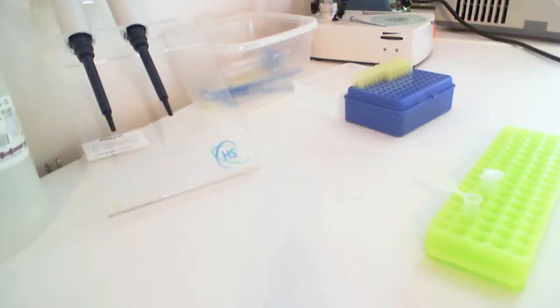Hello and welcome to cloning a fluorescent gene. Before we get started taking green fluorescent protein and putting it into bacteria, I want to give you an overview on how to use some of the equipment that we're going to be using in the biotechnology lab.